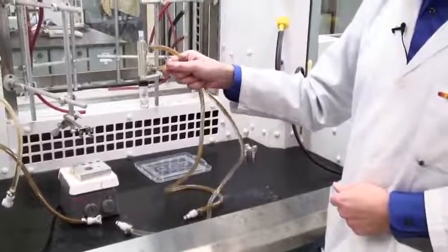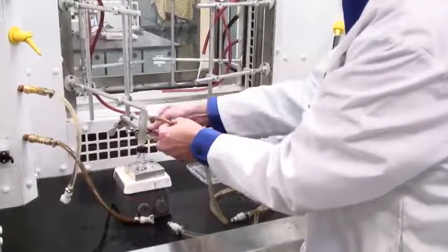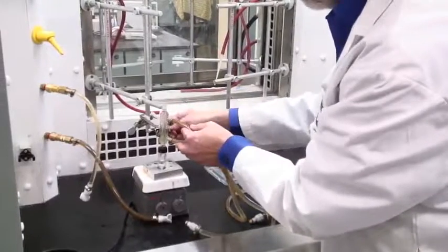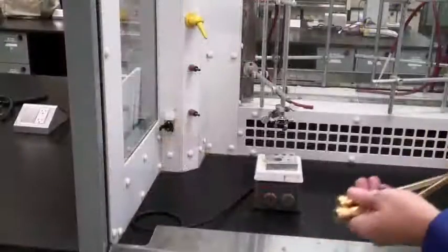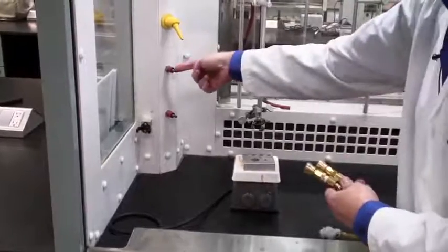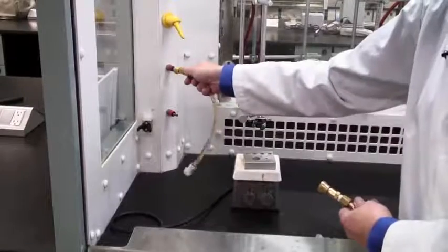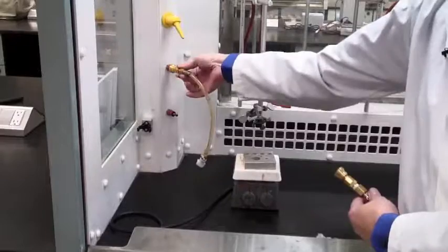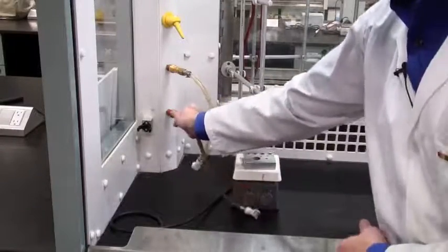This is now ready to put on the heater and get going. It's a good idea to clamp it with your three-finger clamp. There are two water connectors which come from the drawer underneath. They fit onto the water inlet and outlet — slide them into place and you'll hear a click when they are firmly attached.